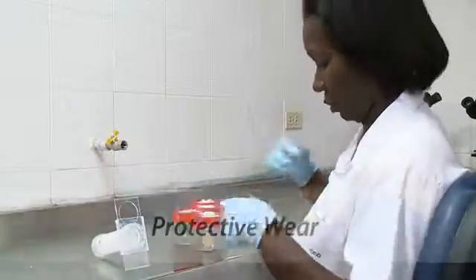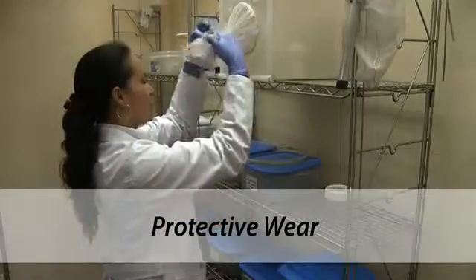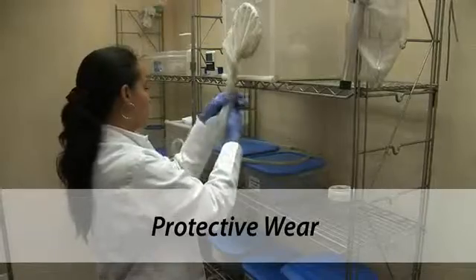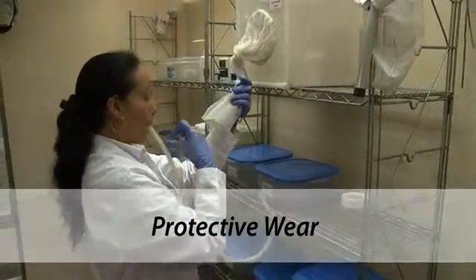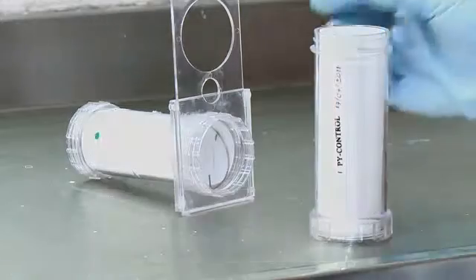Wear gloves to protect your hands from the insecticide, and make sure to wear a lab coat. If you need to go into the insectary to get mosquitoes for the test, make sure to wear a different set of gloves so that you do not introduce insecticides into the insectary. The control tubes are lined with paper that has been impregnated with the same solvent as the insecticide-impregnated papers.